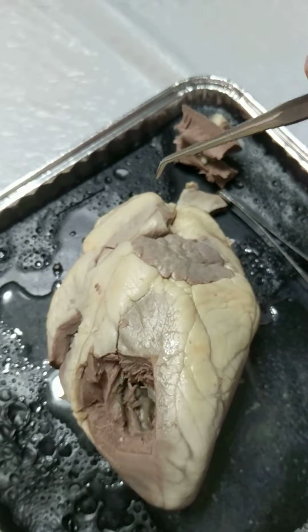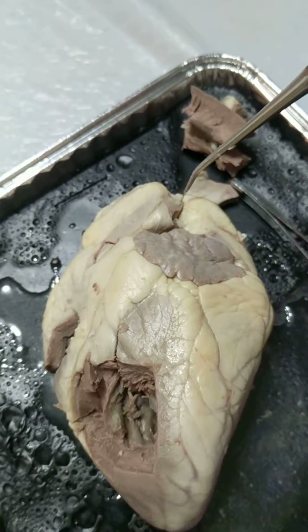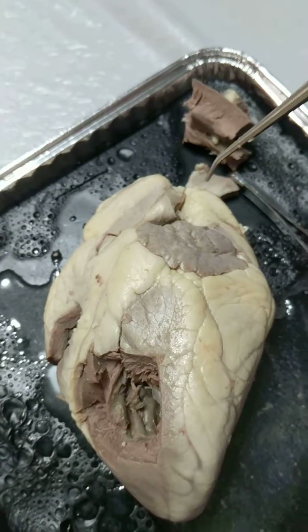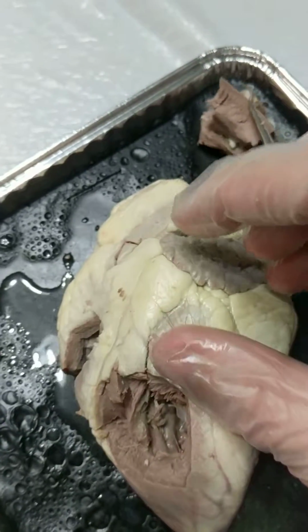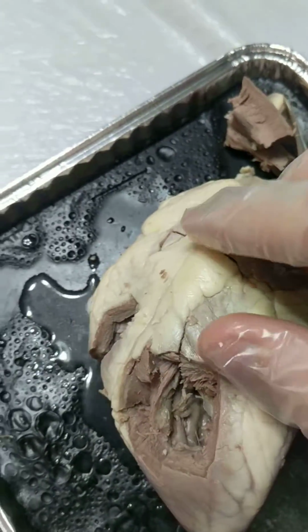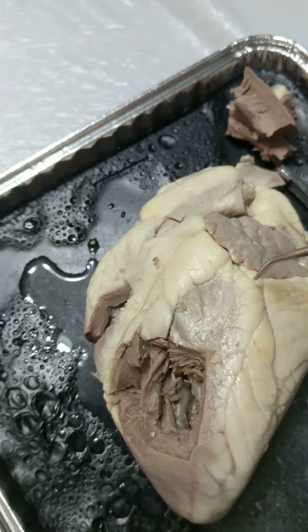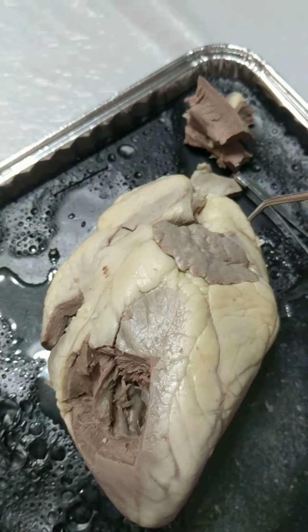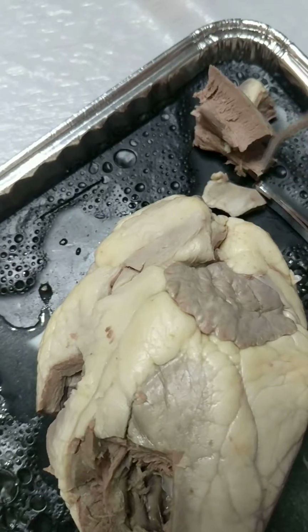There's several arteries that you can actually see here. They're the large vessels up near the top. Specifically, though, they're the ones that carry blood away from the heart. The atrium, or the two upper chambers of the heart, we cut into one right up here. The base of the heart is where all the blood vessels attach that enter and exit the heart. It's kind of this whole upper region here.